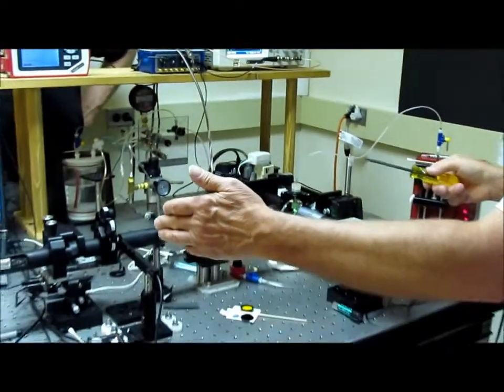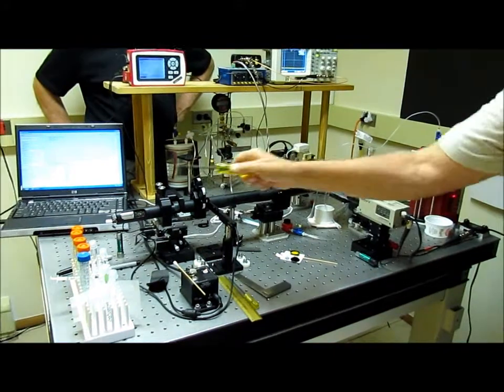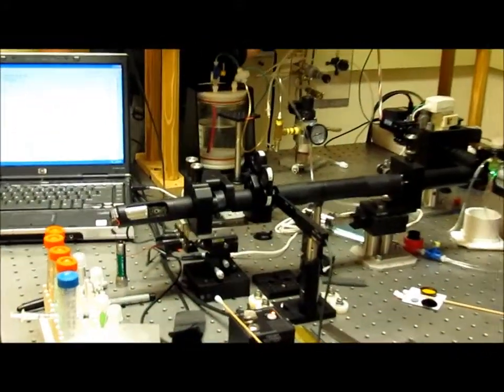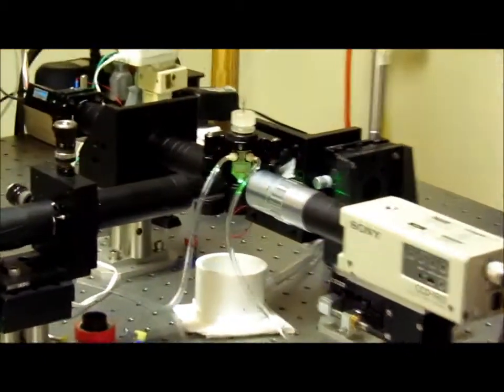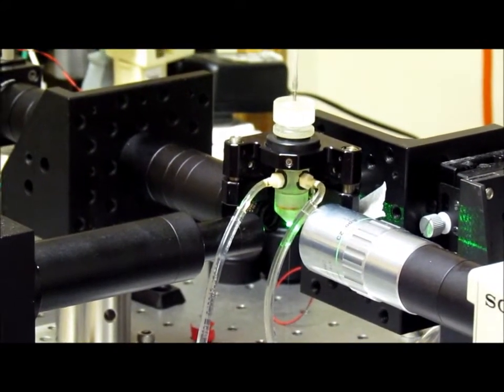The sample, which should be on, but not very visible, shows up right in the middle here, and the laser beam comes in there. The sample is a fluorescent sample, and the fluorescence is excited by a laser beam, which is a small laser pointer located over here on the left side. That laser beam is focused onto the flow chamber. The sample particles are excited by the focused laser beam.